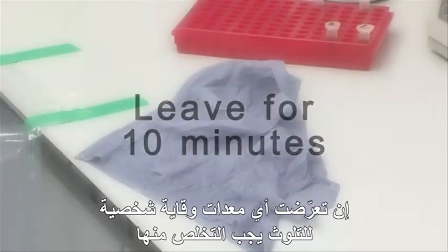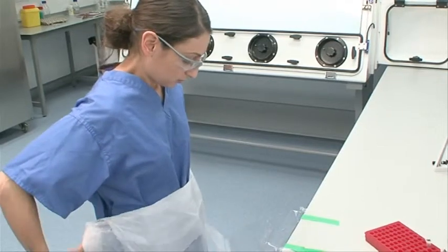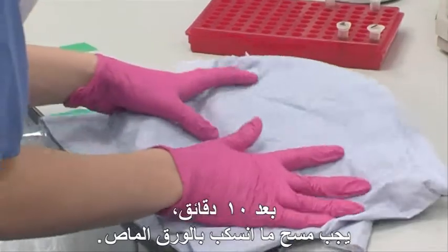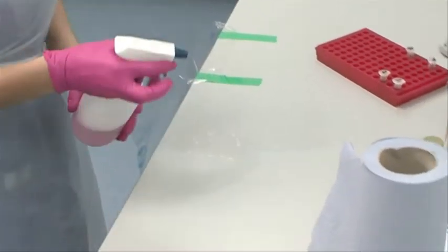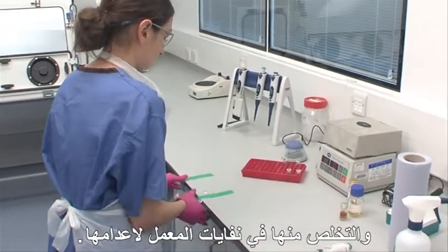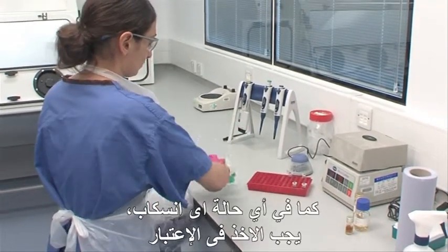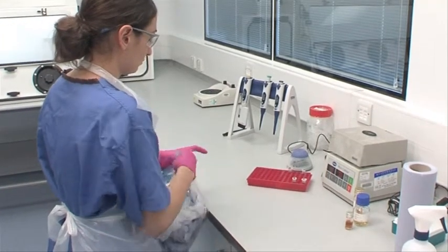Any contaminated PPE should be discarded and replaced with clean PPE. After 10 minutes, the spillage should be mopped up with absorbent paper. Any materials used to clear the spill should be sealed in a bag and discarded with the lab waste for autoclaving. As with any spillage, consideration should be given to the implications of the spill on sample integrity.